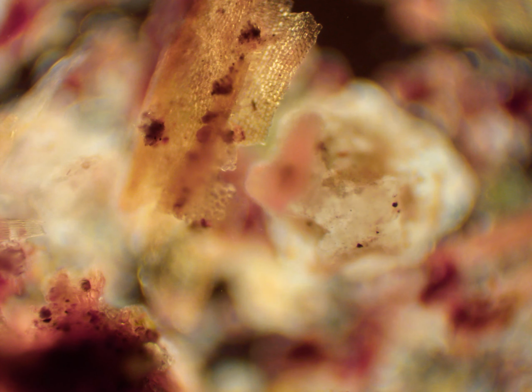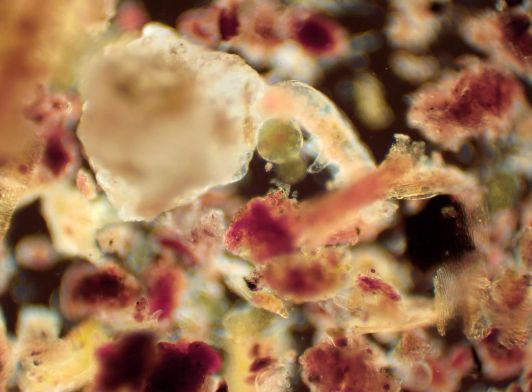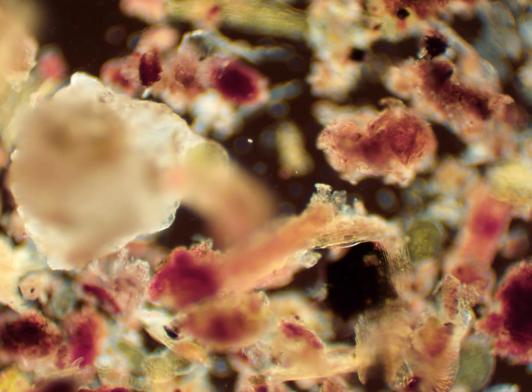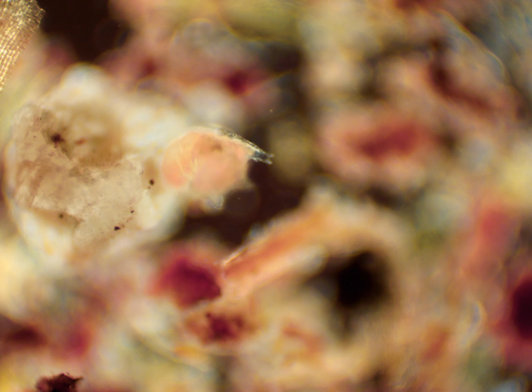You can see it maneuvering on top of this piece of sediment here. This class of tardigrades has a smooth back, and you can see that smooth back made up of several segments on this tardigrade here.